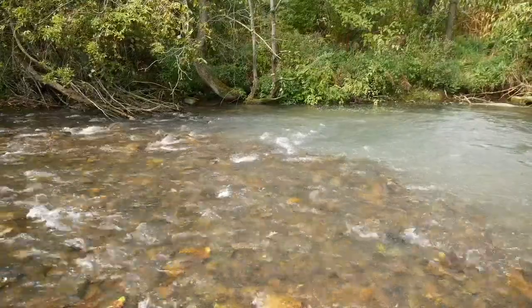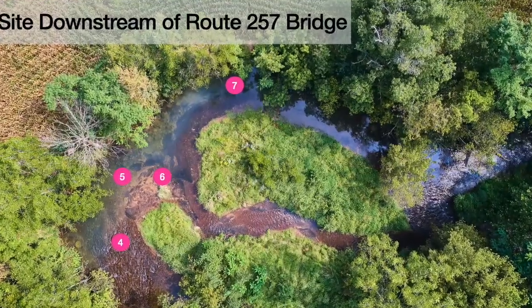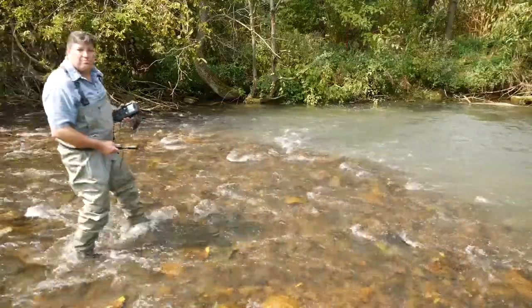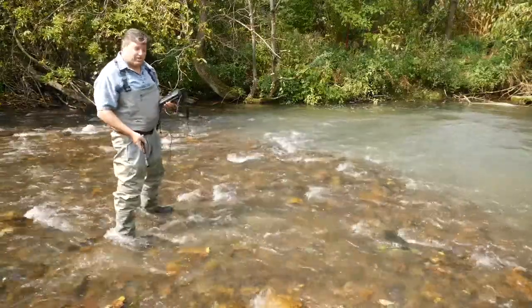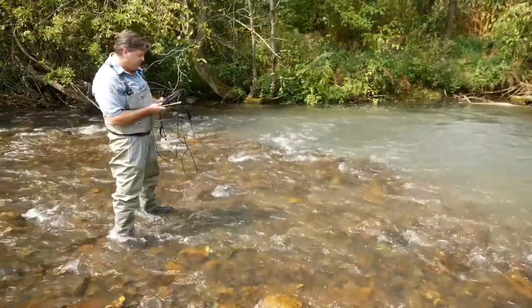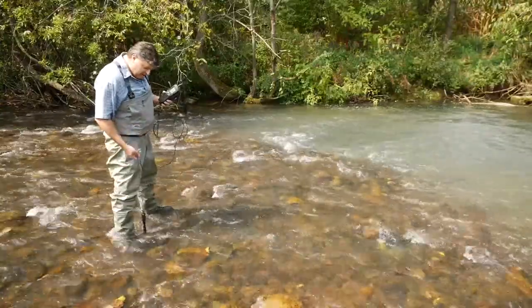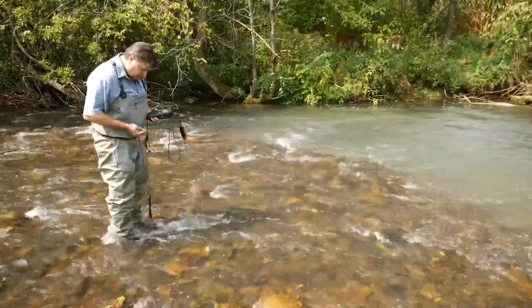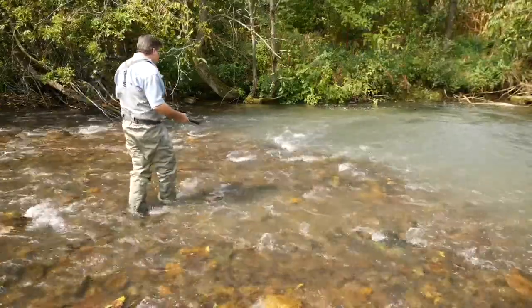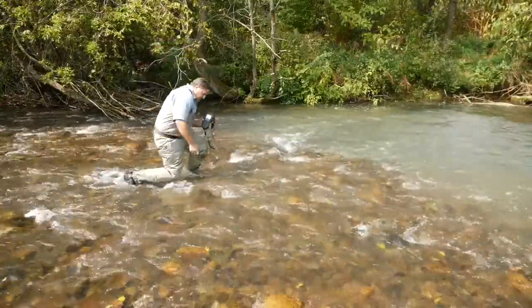And we'll start taking the oxygen measurements in this riffle section. So we'll come downstream and measure the oxygen concentration in this riffle section. I have to turn the instrument back on so it's warming up. And now extend the probe and again try to sample just off the bottom of the current. And it looks like I'm going to have to hold it in place because the current's moving pretty briskly at this location. So the instrument is ready to be read.